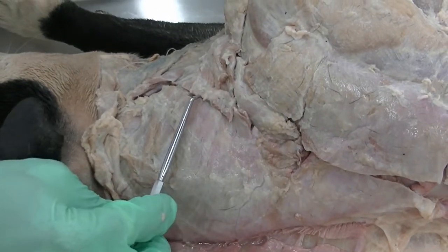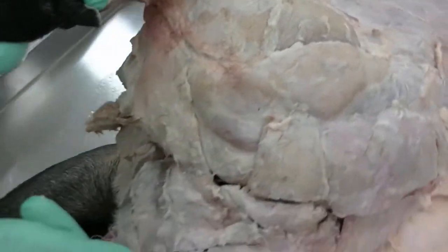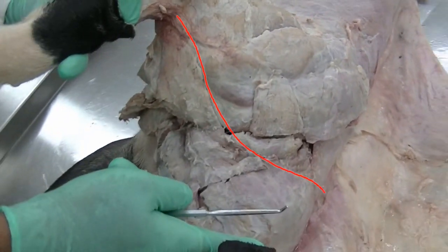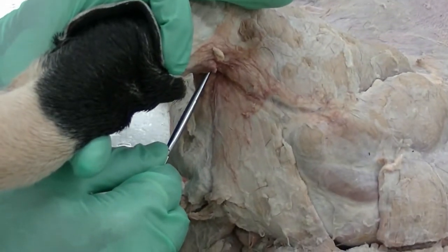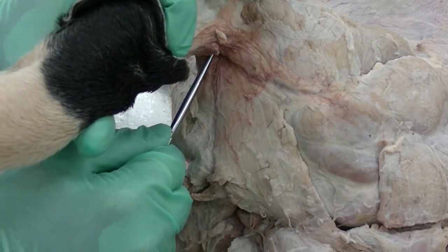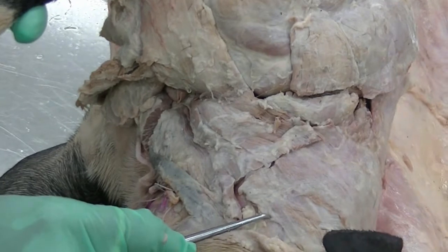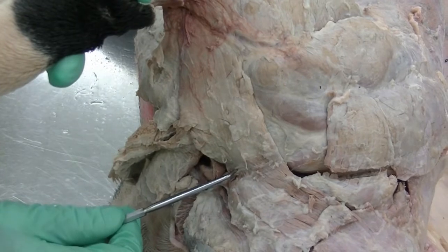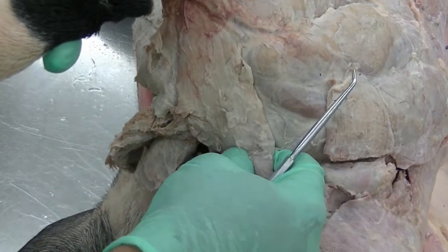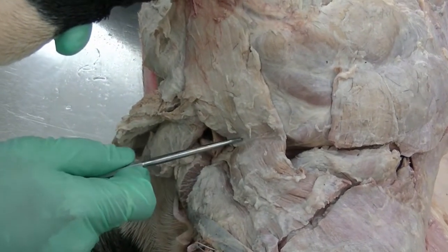The next muscle we are going to look at is the brachiocephalicus, the muscle which runs from the brachium to the head. The muscle at its attachment towards the arm or brachium is much narrower or tapering, while towards its attachment on the neck as well as on the head, the muscle becomes much more widespread. As a remnant of the bone clavicle in the dog, we have the clavicular intersection, which can be palpated in the middle of the muscle. That line indicates the clavicular intersection.